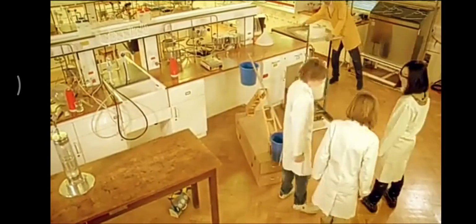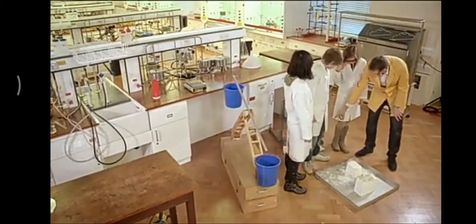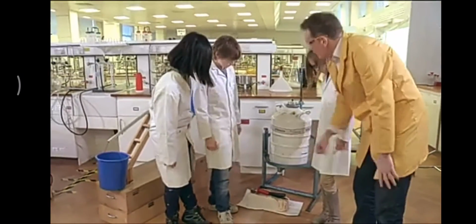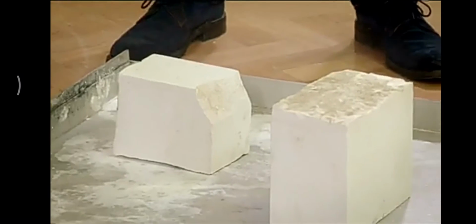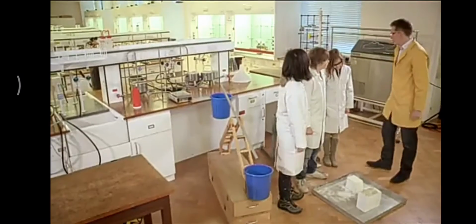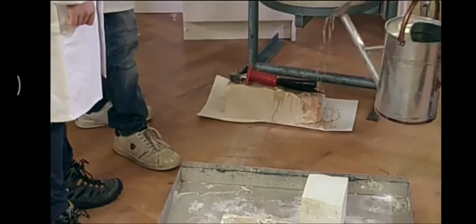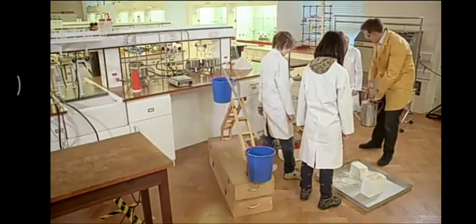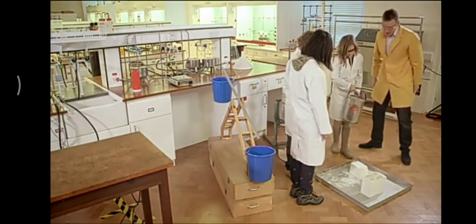So that's the carbon dioxide produced in our experiment. But what about the calcium oxide left in the test tube? How has that changed? This started off just like the rock that you chipped away. That was calcium carbonate. We've heated this one up. It's cooled down again now, but it's changed. So it's no longer calcium carbonate. What is it? Calcium oxide. Calcium oxide. And I'm just going to put some water on this. Well, what's going to happen? What do we get? Wet rock. Wet rock, OK. But if I give you the watering can, what I'd like you to do is just sprinkle a little bit on the rocks, both on the rocks there.